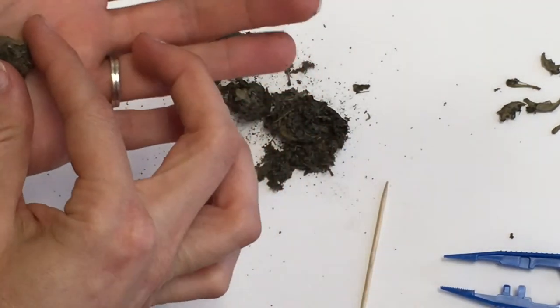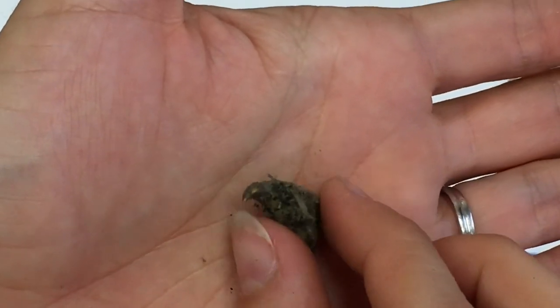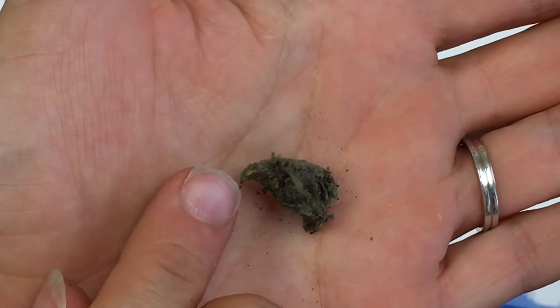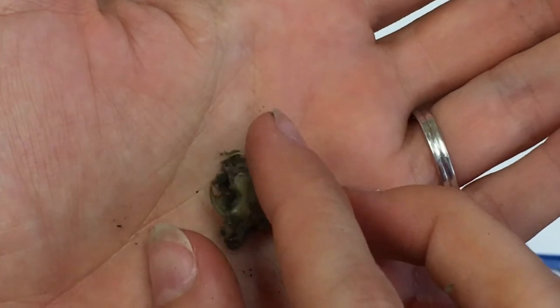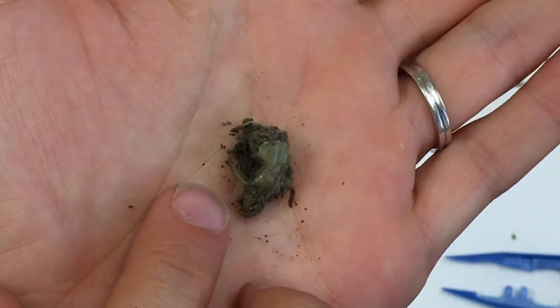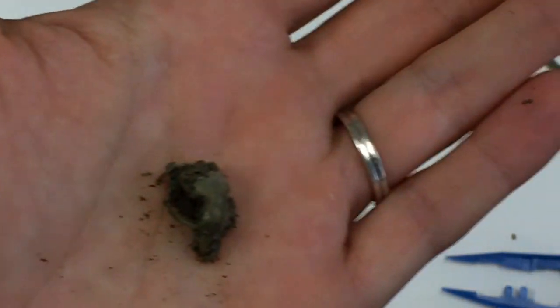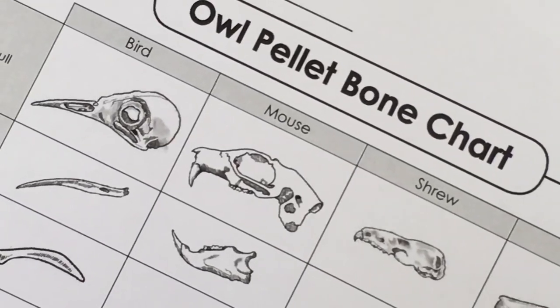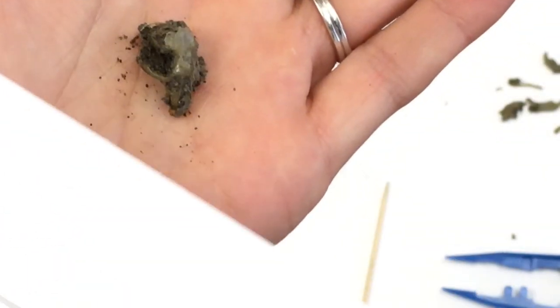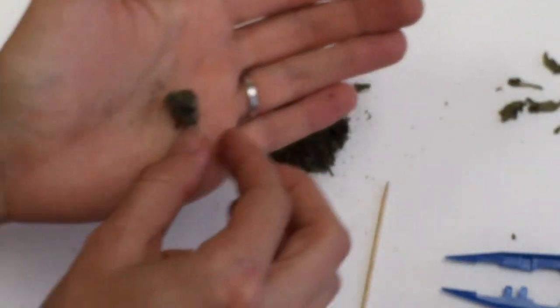Let me show you this. I have this little skull here — you can see the front of its mouth and from the top where its eyes were. I'm looking at my bone identification chart and I think that this is a mouse skull — that's kind of what it's looking like to me. Very neat.